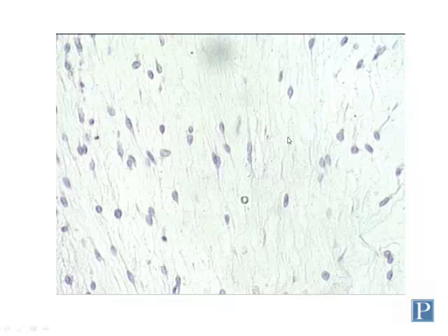And so these cytoplasmic processes possess lots of chemoreceptors. The cells are actively sensing chemical gradients which may allow them to differentiate into specific types of tissues. So this is mesenchyme. You may also see some developing bone or blood vessels or developed types of connective tissues on that slide.